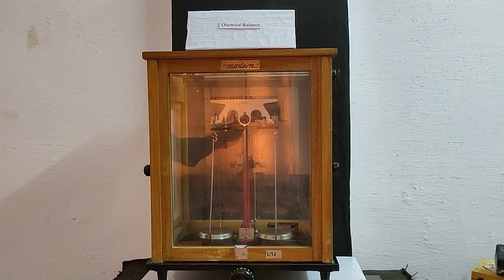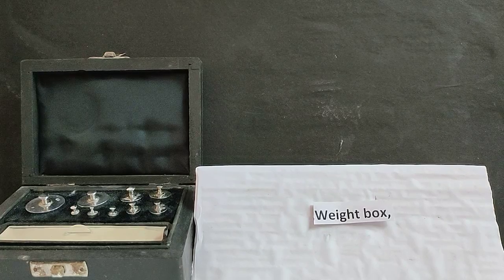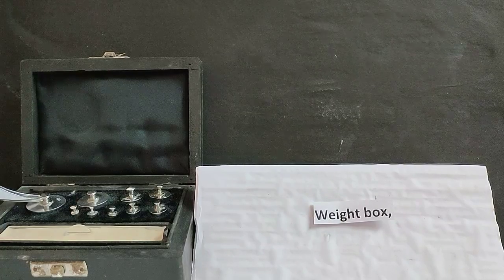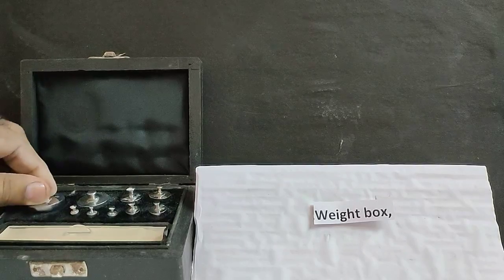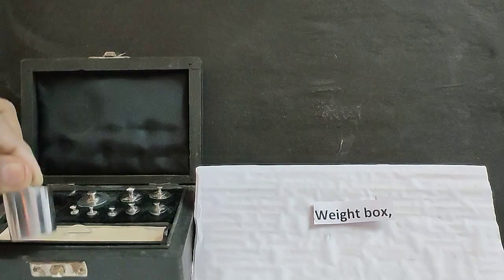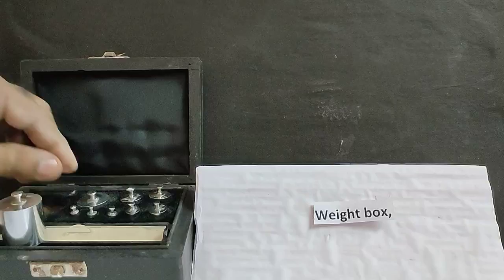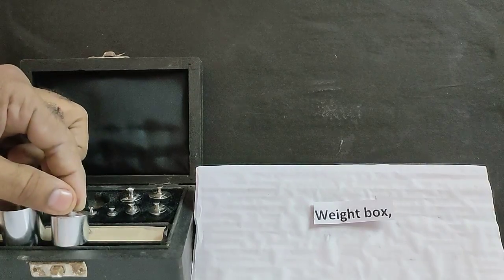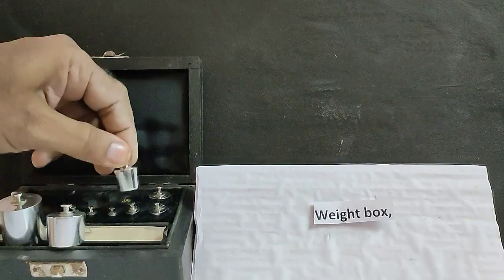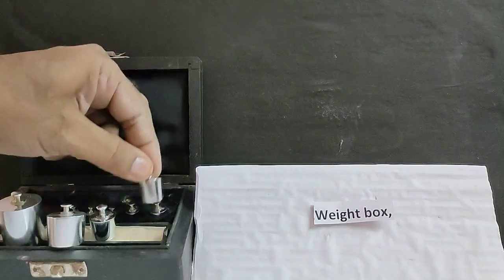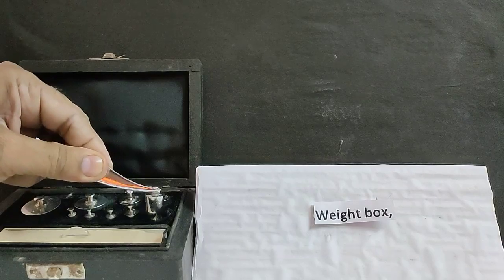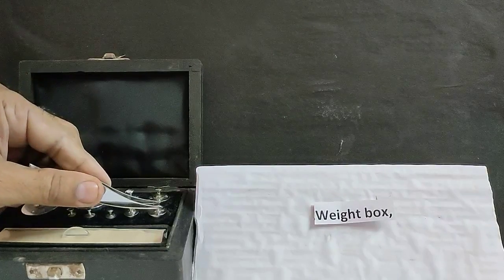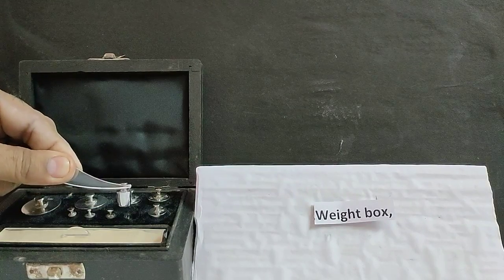Chemical balance with weight box having one weight of 100 gram, one weight of 50 gram, two weights of 20 gram, and one weight of 10 gram.